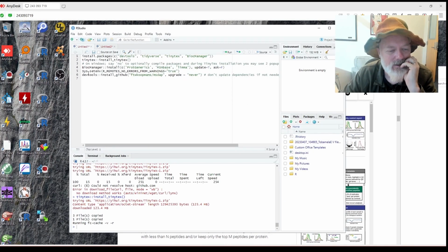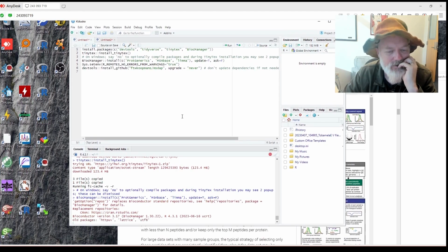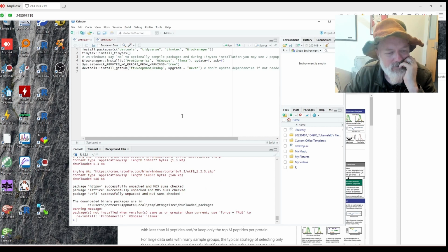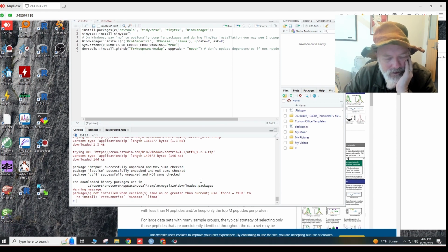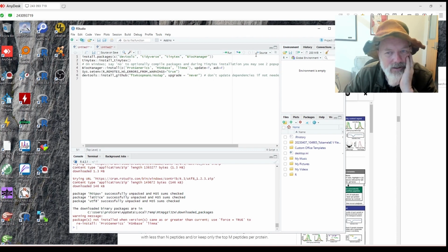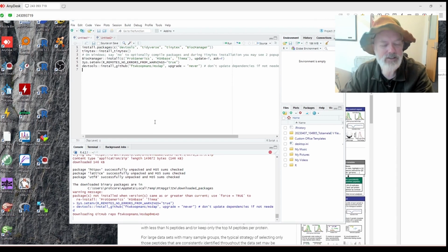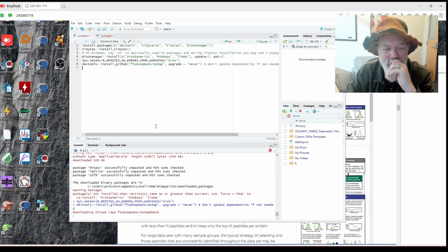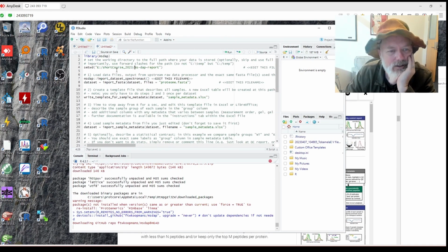Okay. All right. So it looks like TinyTeX is installed. Let's try this again. Warning, packages not installed in this version, same or greater to force a reinstall. Same or greater than current. Okay, I think that's probably fine. All right, so errors is true, and then we'll do this. Do devtools, which requires RTools, which we just installed. All right, so let's see. It looks like it's working so far. All right, so let's see what we do here. I think this is right.